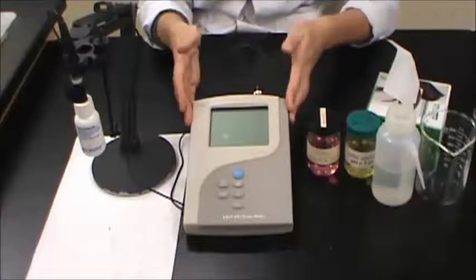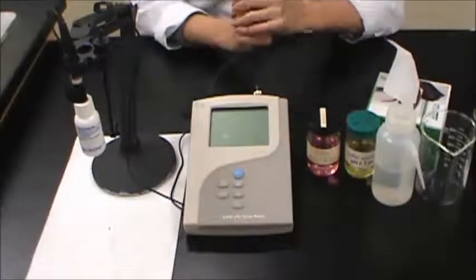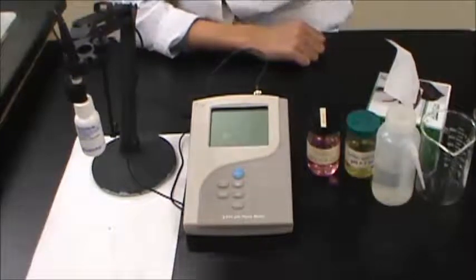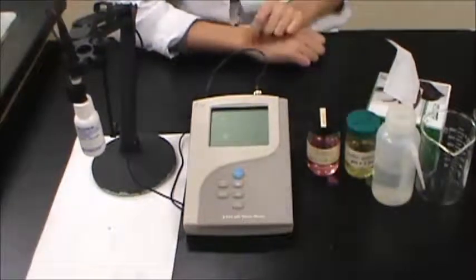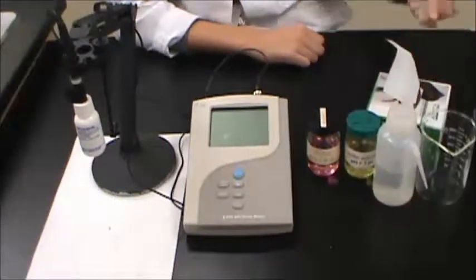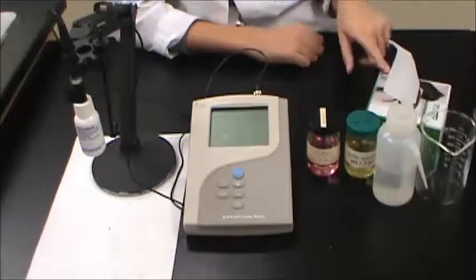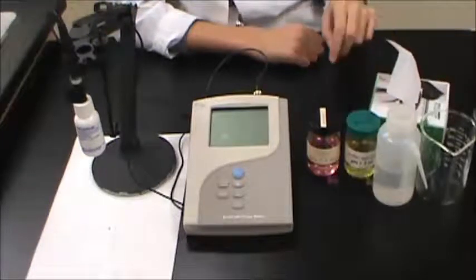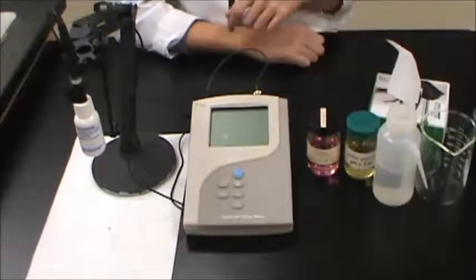A pH meter and stand with a temperature and pH probe, deionized water and a waste beaker, some kim wipes, and two different pH buffer solutions.